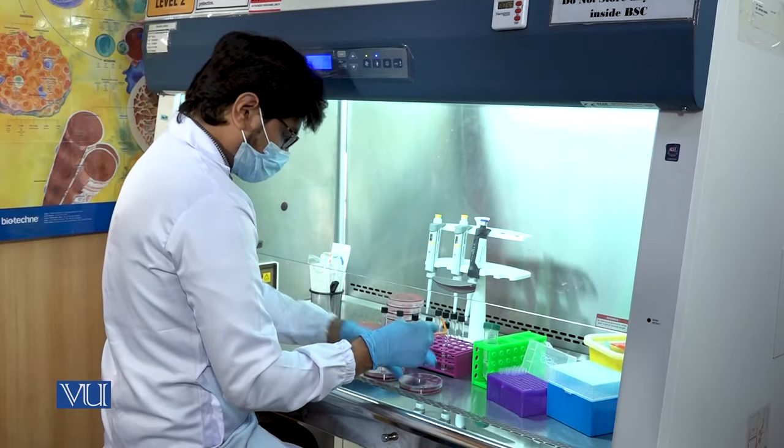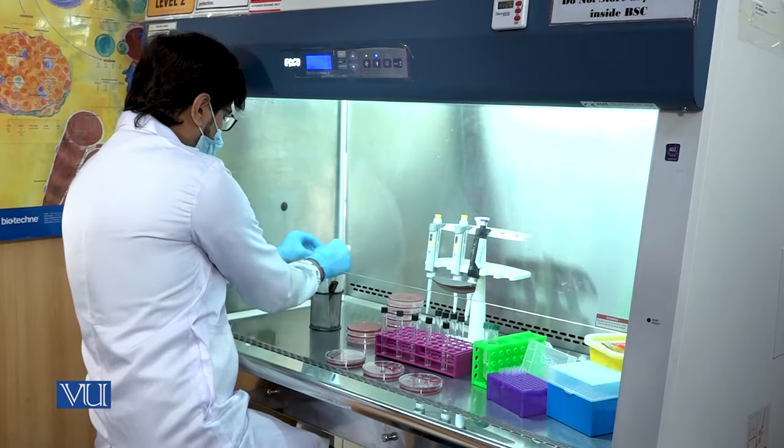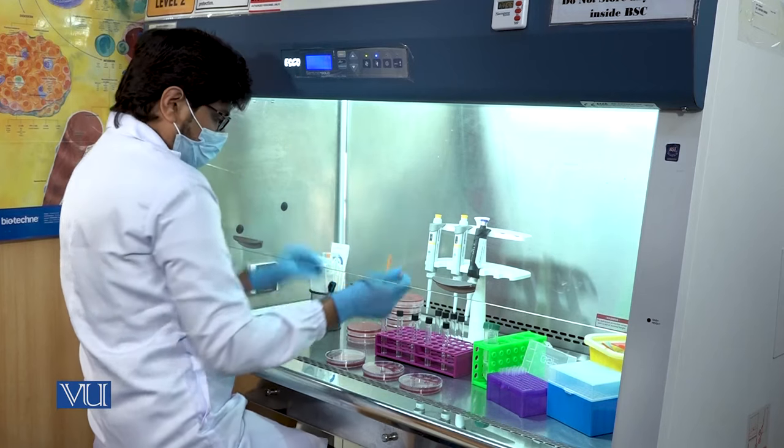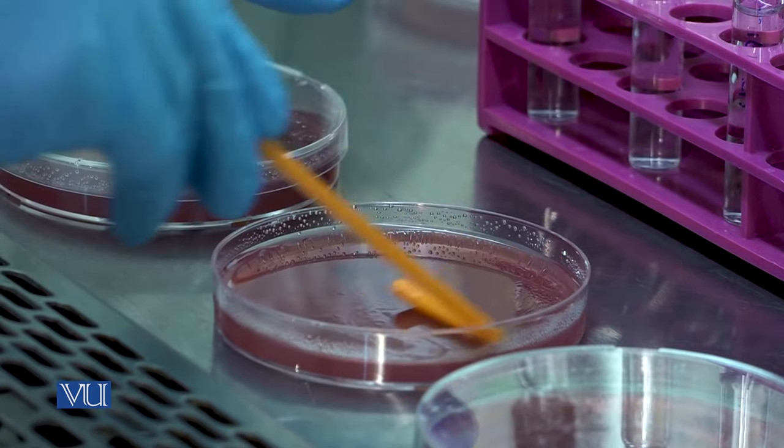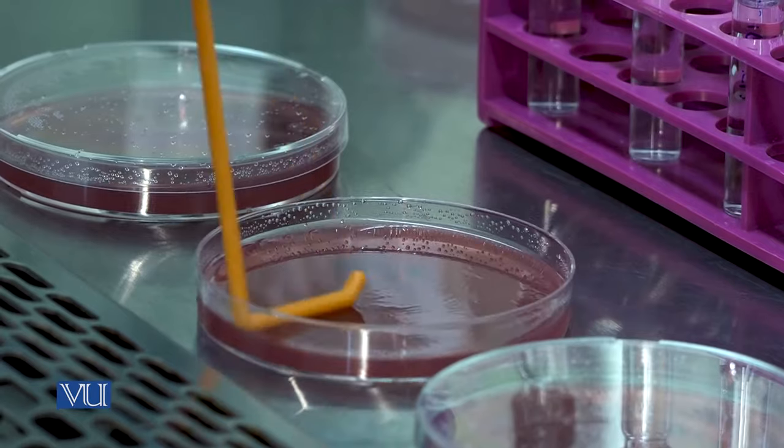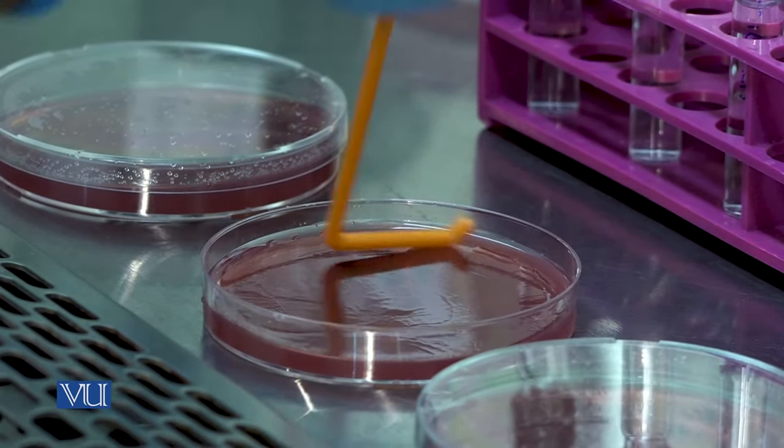After use, discard the bacterial spreader. Take out another bacterial spreader and repeat the spreading procedure for the second dilution in the culture medium. Make sure to cover the corners of the culture media plate as well.